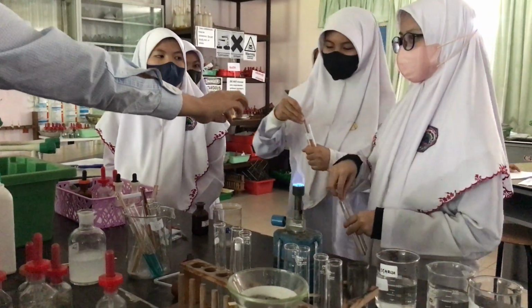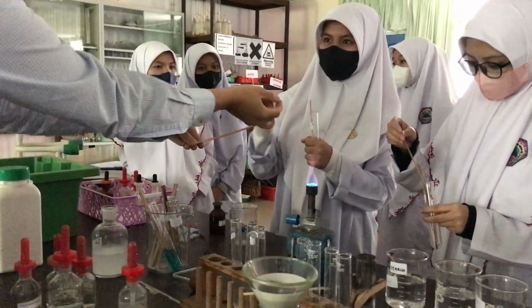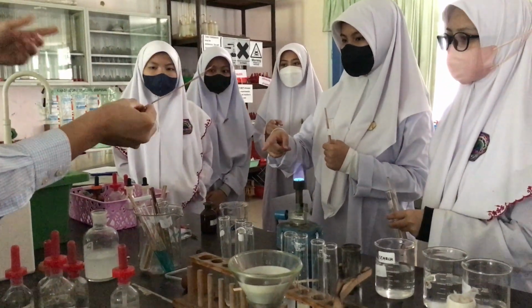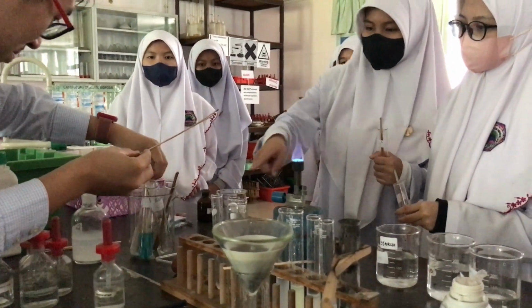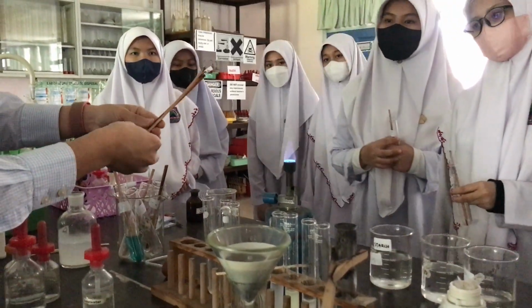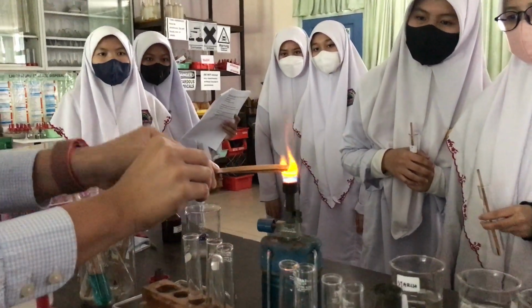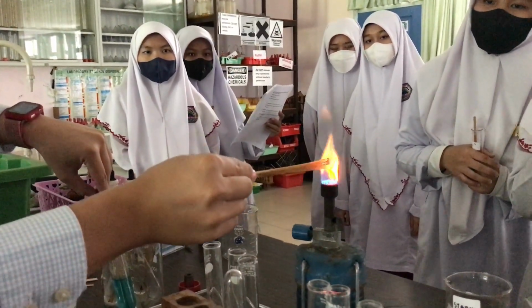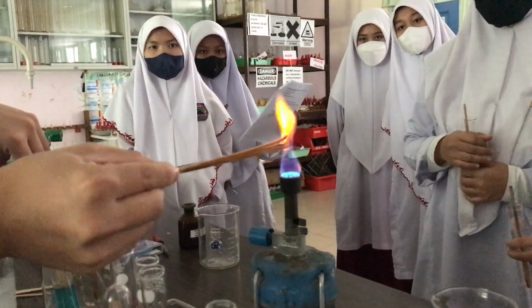Come, give me one stick, just give me one stick. Mixture of colors, right? I don't know which one is that one. I also don't know which one is that one. Can you give me one? What's the other one? Oh no, there's the wrong one. Okay, what if you have the three colors mixed together? Not that strong, right? You see the slightly different color now? There's some red color. There's some lilac as well on the other side.